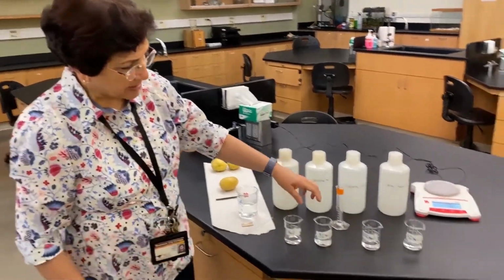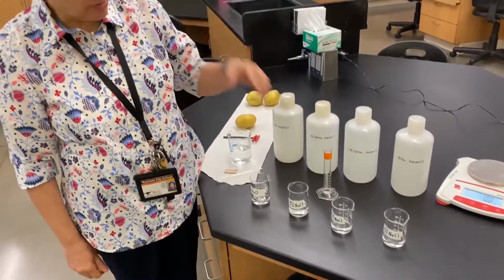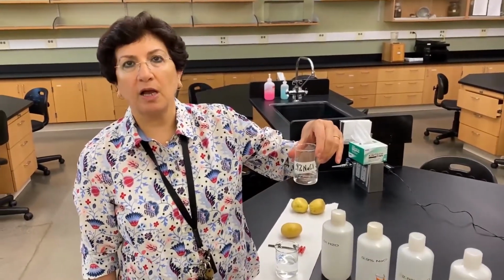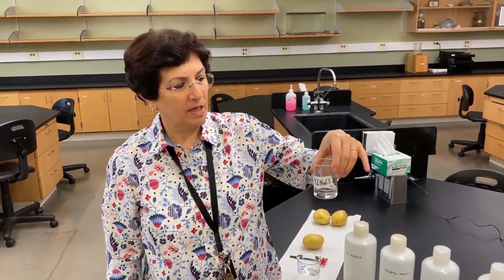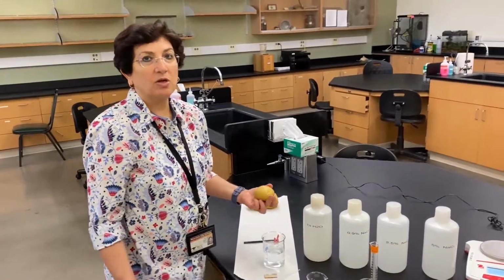The first treatment I'm going to start with is the 0.9%. Why do you think we went through the trouble of preparing 0.9 and not 1% salt? Do you think there is any significance to that? Well, I will tell you that 0.9% is actually considered an isotonic environment to the plant cells, because in plant cells and other cells, there are some solutes.